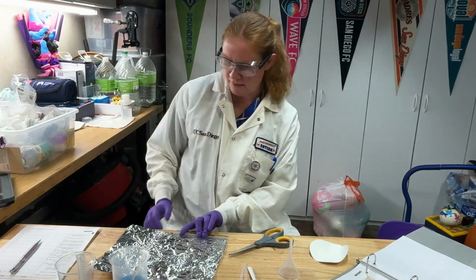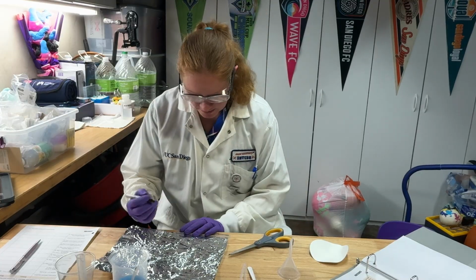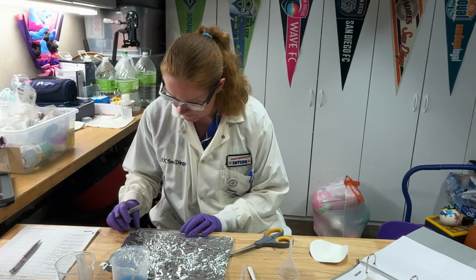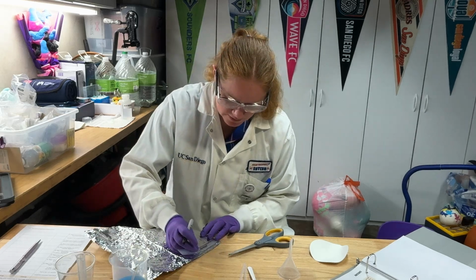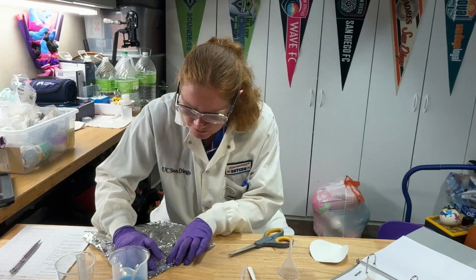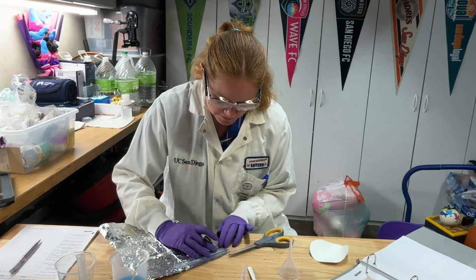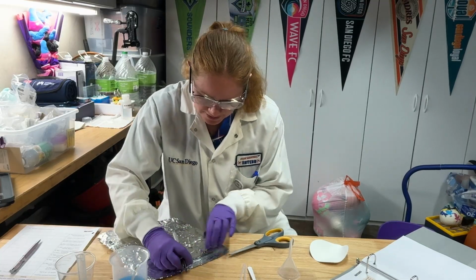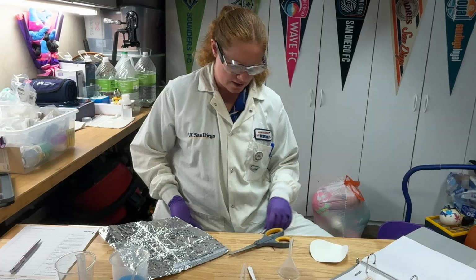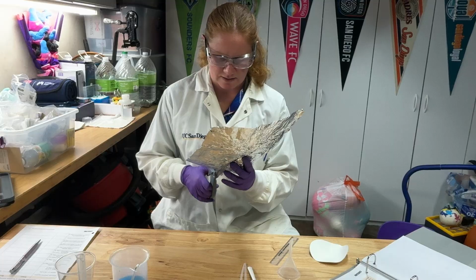So let's see here. It can also help if you have a little marker because the ruler is only 6 inches. So I'm going to make a mark here. And then, let's see, that's not quite 12 inches. What if I go the other way? That's also not quite 12 inches, so that's okay. Again, it's not important that you're exactly 12 inches because you do have more aluminum foil than it says. So if you do end up needing a little bit more later, you should be able to. All right, so I'll mark my 4 inches there, and I'm going to go ahead and cut my foil.